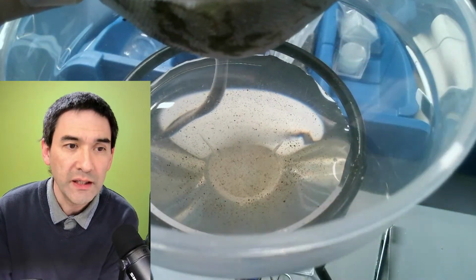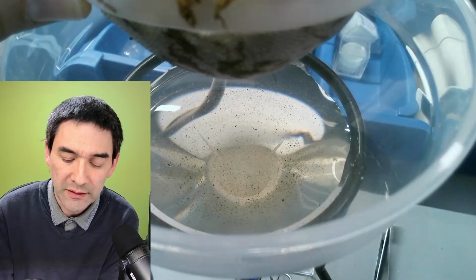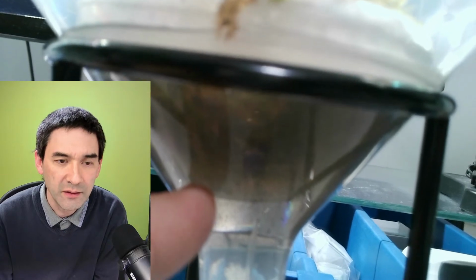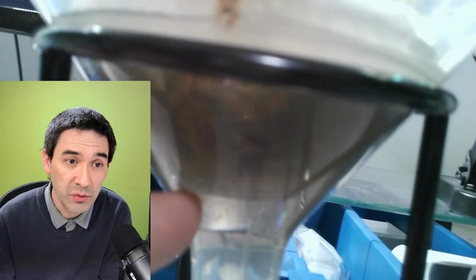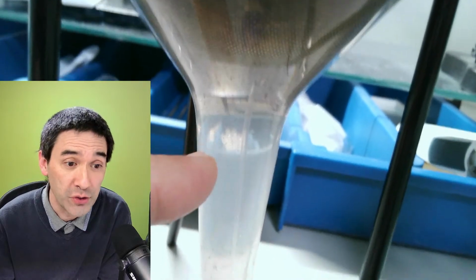And you can see already here that the particles and also other organisms that are in the moss go into the water, and then they will fall down through the funnel. The sieve will kind of retain the moss. Some people also use soil samples. Then the particles and the tiny worms and a lot of rotifers and so on will fall down here.